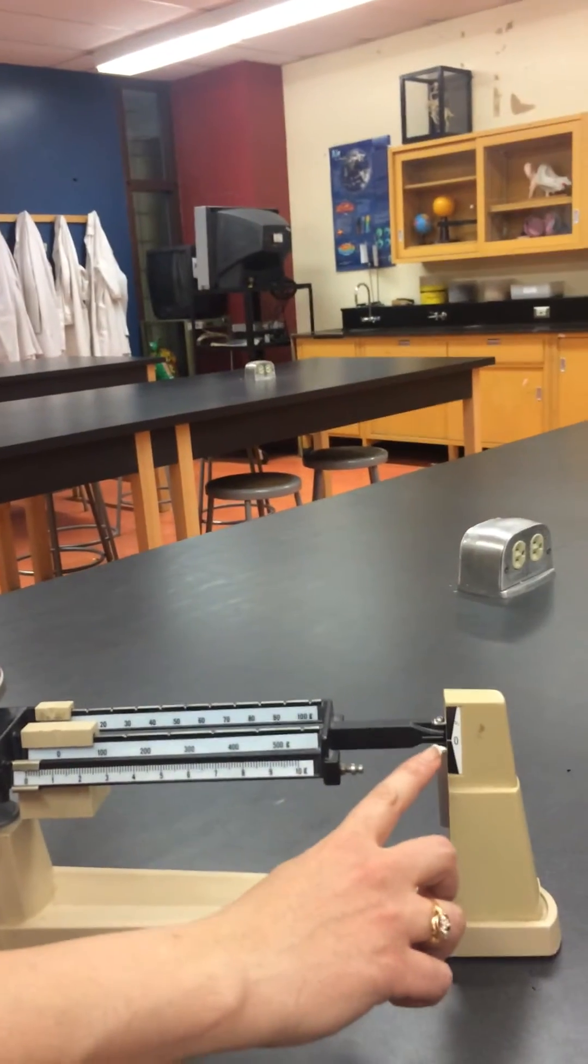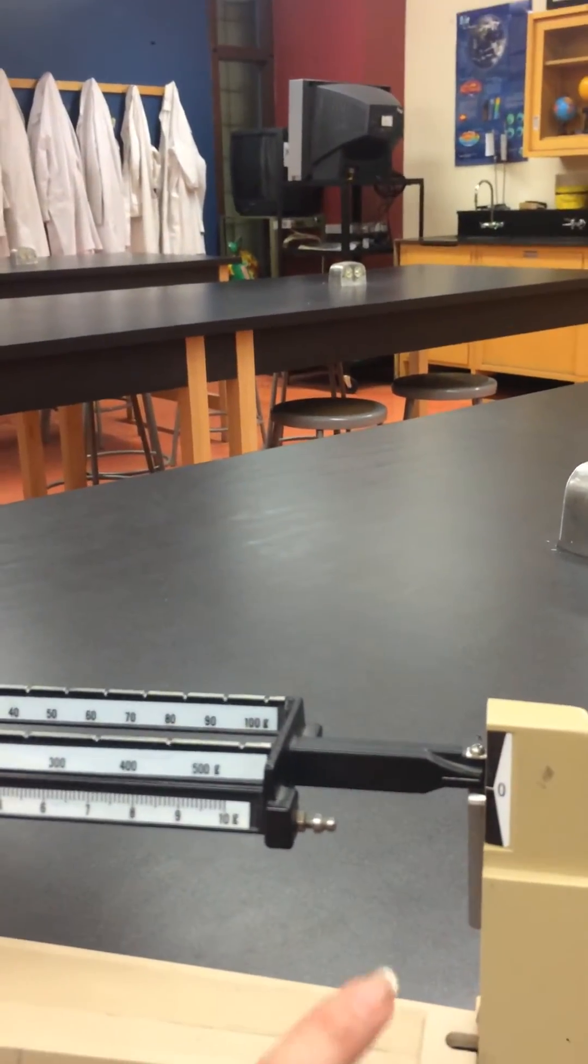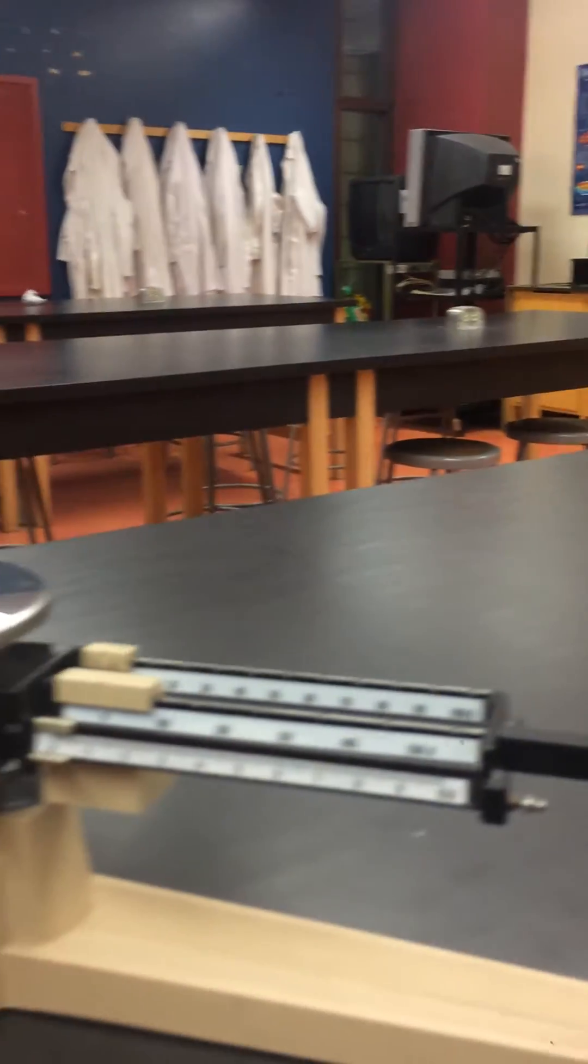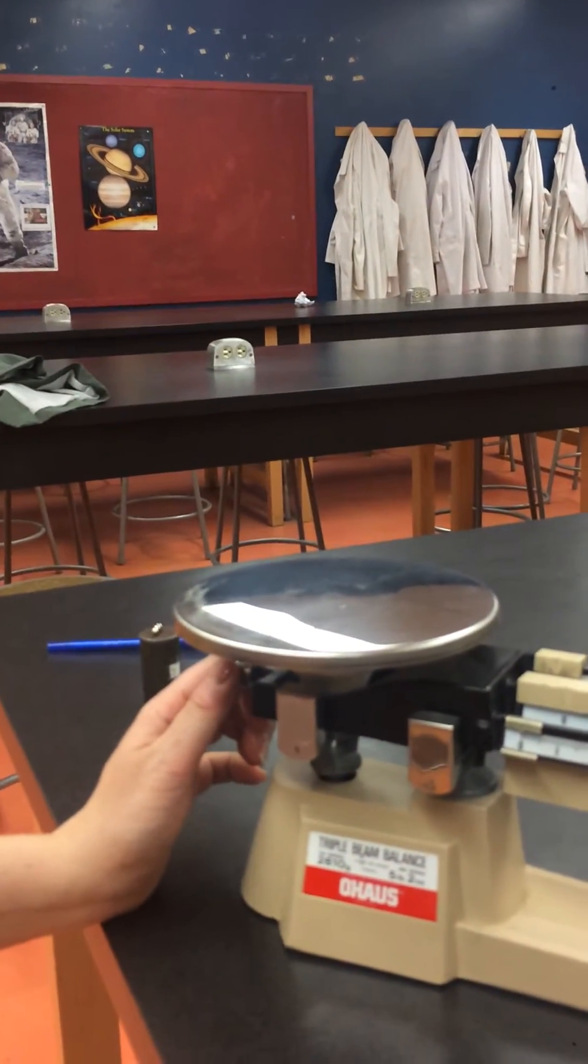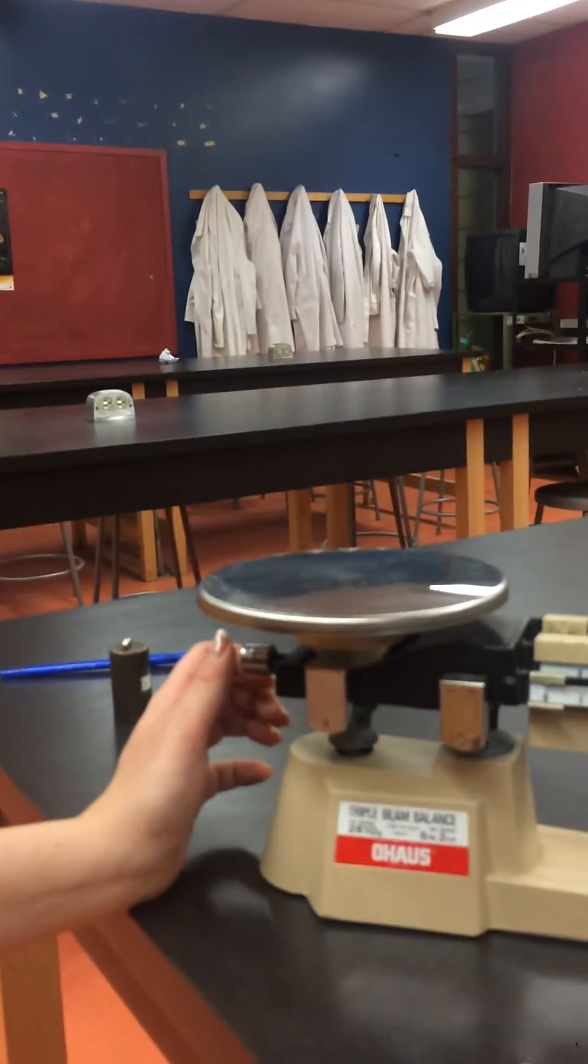And that the line at the end is adjusted to zero as well. If it is not adjusted, you can move the knob slowly to adjust it. There you go.